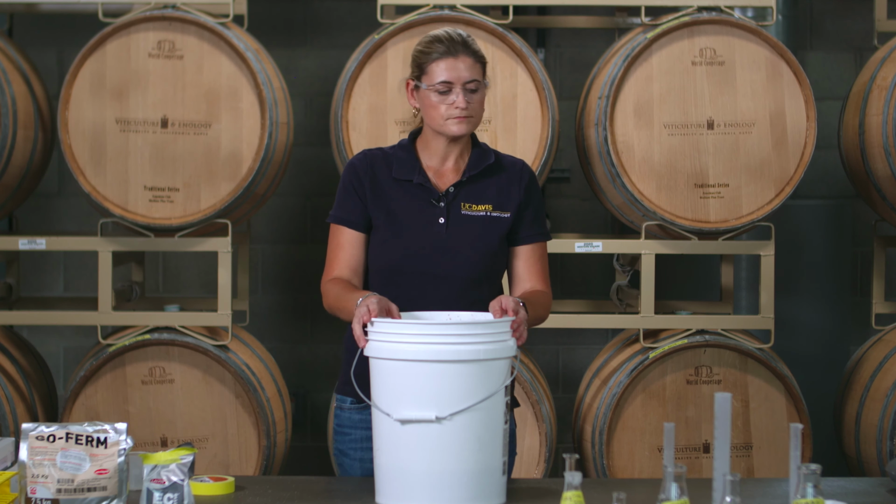First step, get our yeast slurry ready. You need to heat some water. The hot water in your tap, in your kitchen, may be good enough. However, as we're here, I have a heating plate, I have a glass beaker with about 100 milliliters of water in there. We're ready to inoculate with our yeast.